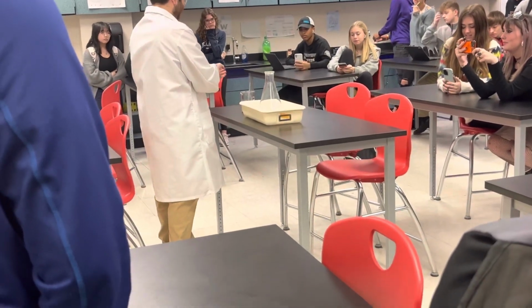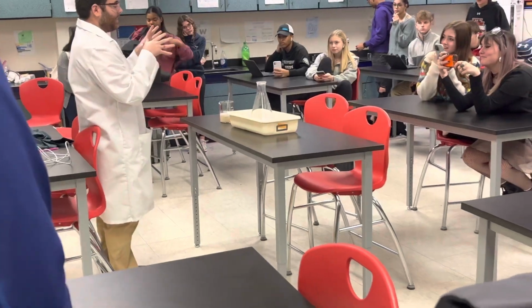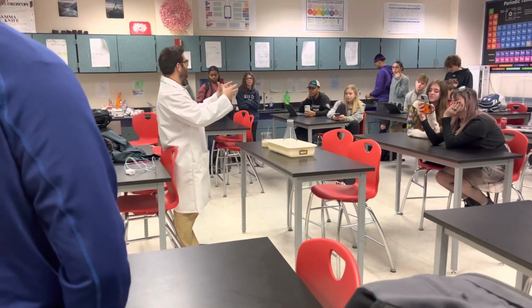It's not for the camera. Why don't we give my watch to this guy? It was bad. So, alright. What? Yeast, girl, you're stalling. No, yeast is the catalyst, right? Stop stalling, girl. Which means it's not going to... the catalyst makes it go faster.